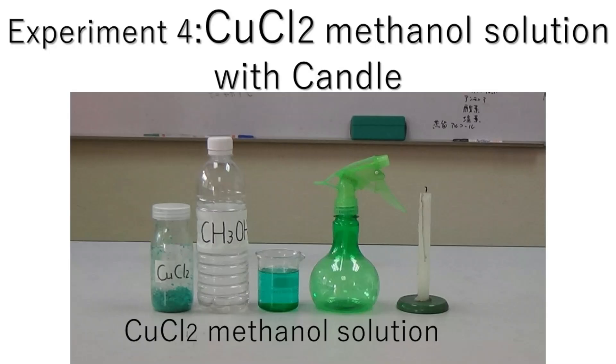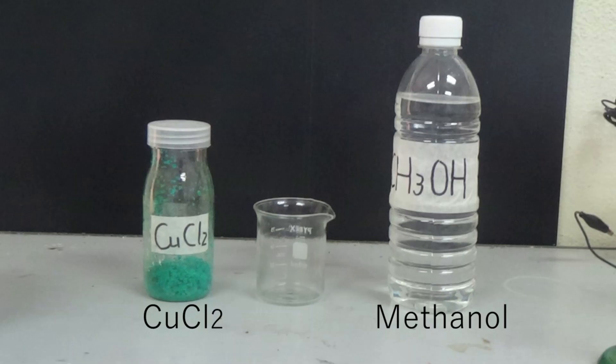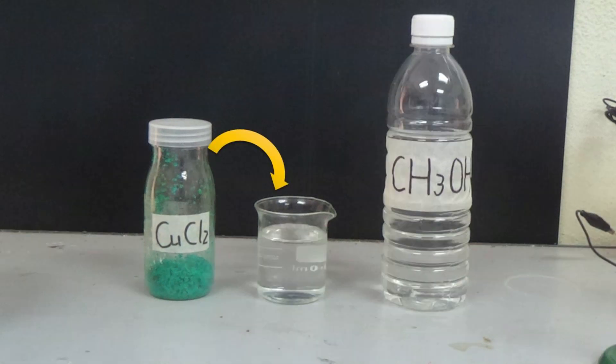In order to observe the flame reaction with a candle, let's conduct an experiment using a copper chloride solution in methanol solvent. In preparation, make a methanol solution of copper chloride.